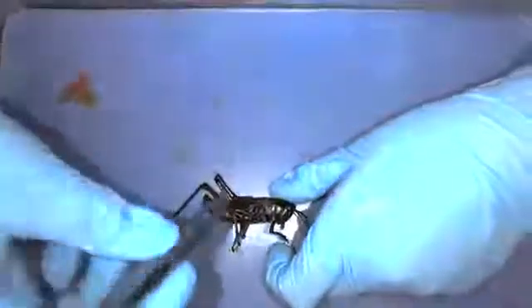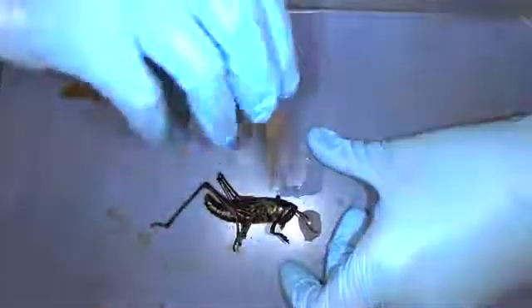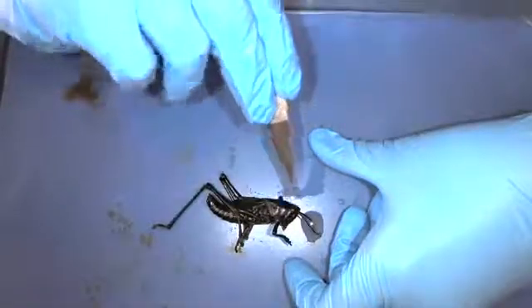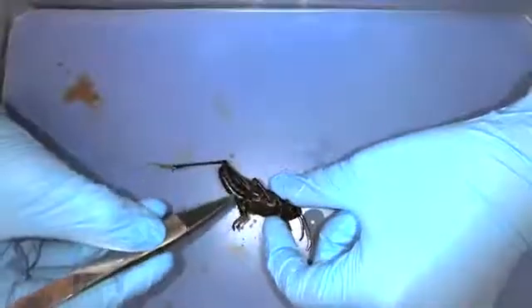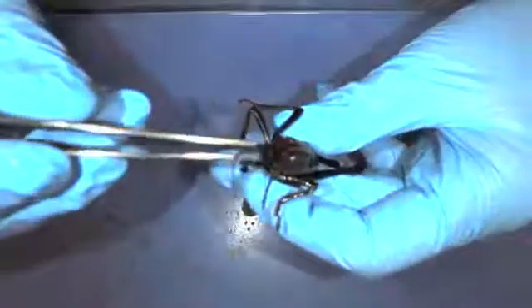The grasshopper is segmented, which means it's broken into different portions. There are three segments: the head up here in the front, the thorax which is kind of the middle of the body, and then the abdomen which is the very back of the grasshopper's body. Up on the head there are two antennae.